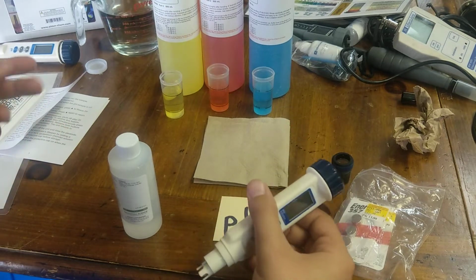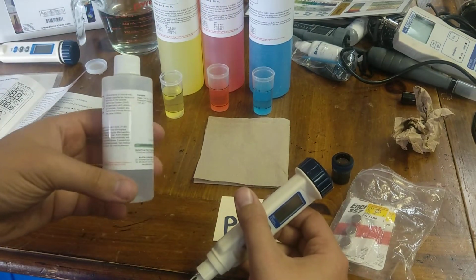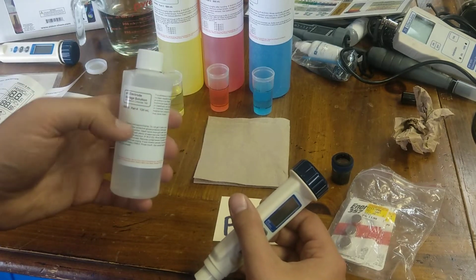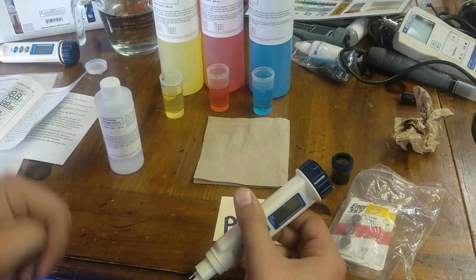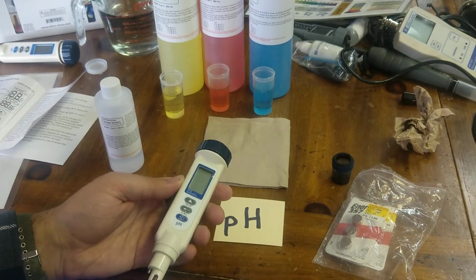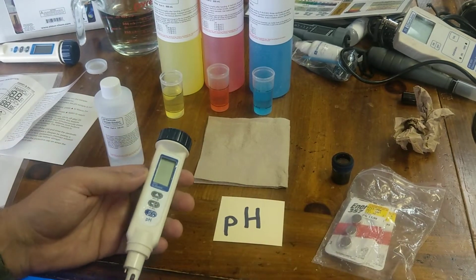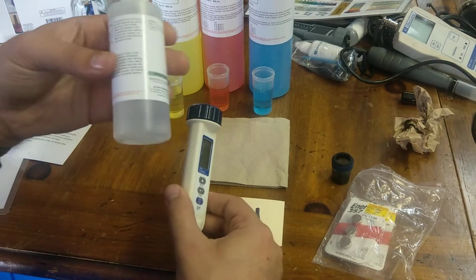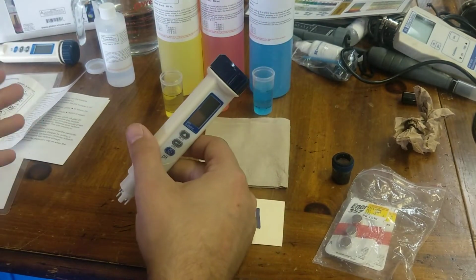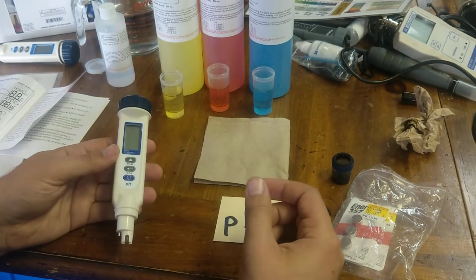After they've soaked, I will then return the KCl back here. It's just salt water, basically super saturated salt water, but with a very special type of salt. And that right there you can return in there if it's not been contaminated. If this is completely wet and you contaminated it, maybe not use it, but this I'm sure you can return if these were stored fairly dryish or with KCl solution already inside. You can just soak that in.